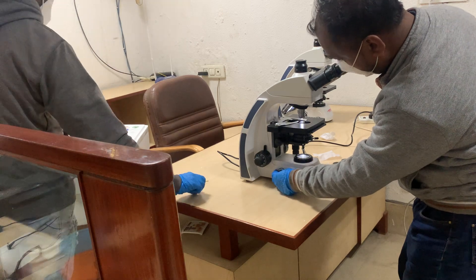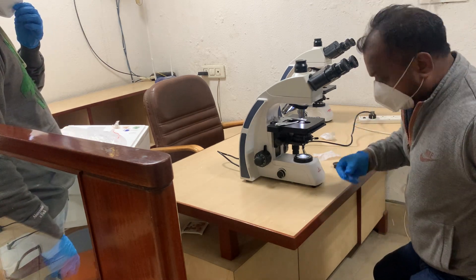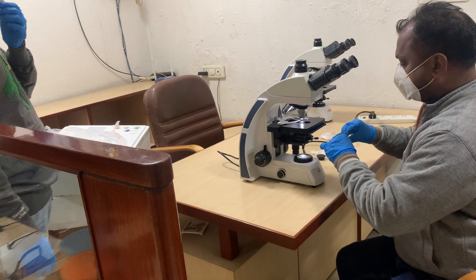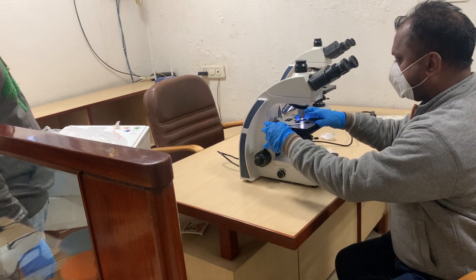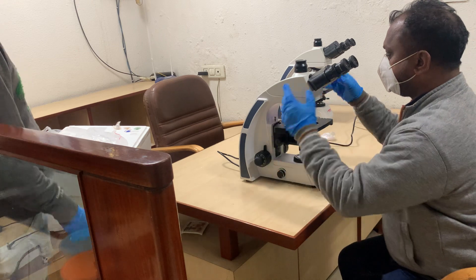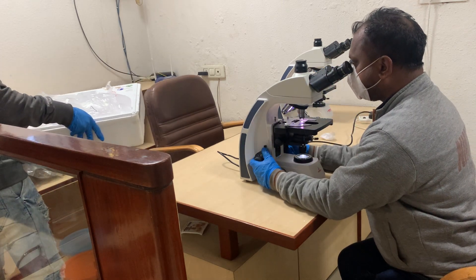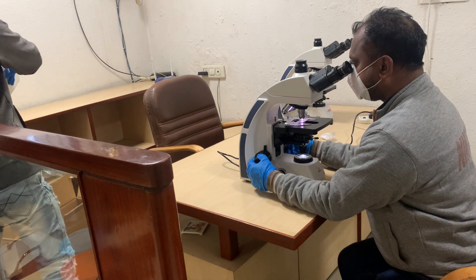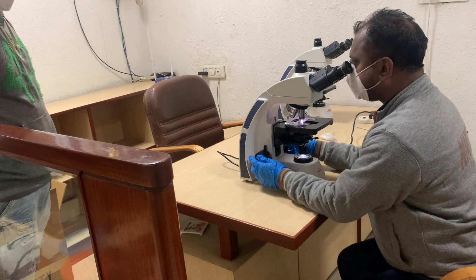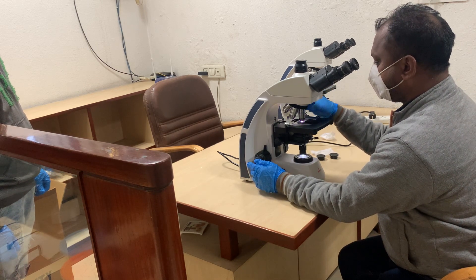Once the intensity is on, all you need to do is put the slide on. If you are focusing at 4x or 10x, we recommend bringing the condenser down so that the light is streamlined and adequate. Once you focus at 4x, you can shift to 10x and subsequently focus at 40x.